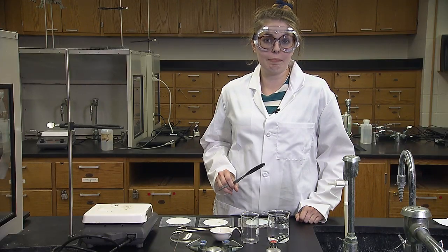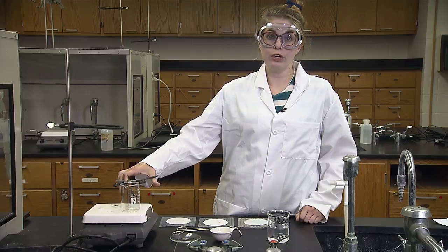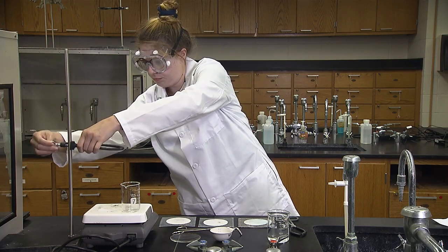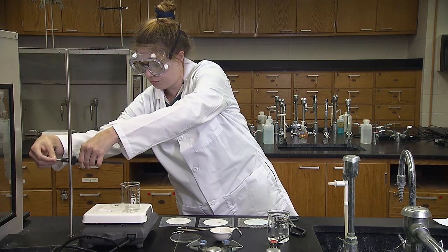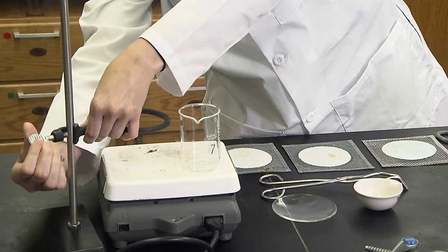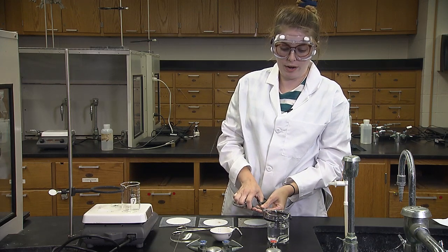A beaker may be heated by itself or used as a hot water bath to heat other items. The hot water bath is stabilized with a ring clamp.